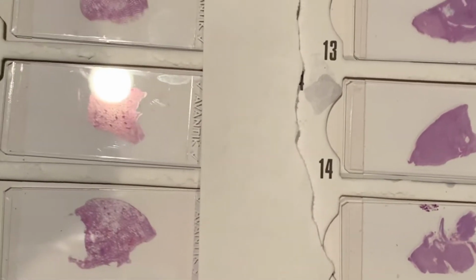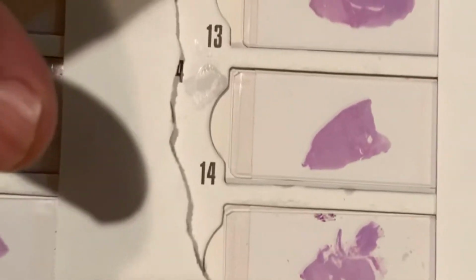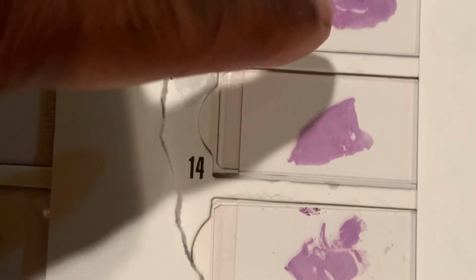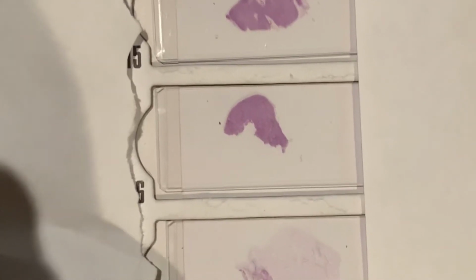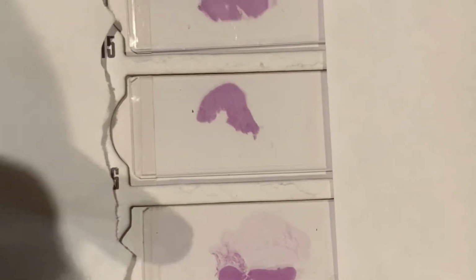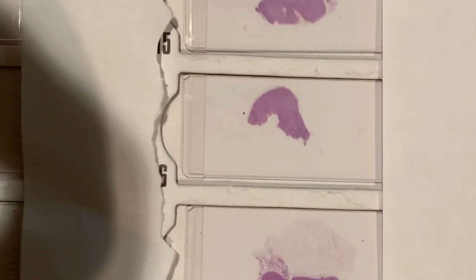On all of my cases, I usually submit lung sections, I submit heart sections, even including coronary arteries. And then I submit pancreas and liver, spleen and liver sections, along with kidney sections and adrenal glands. I'm going to go to the next slide to show you additional sections. Okay, this is the start of intestinal sections. You can see I submit sections of stomach and small bowel, large bowel. But I'm going to stop this video to show you the next tray of slides.